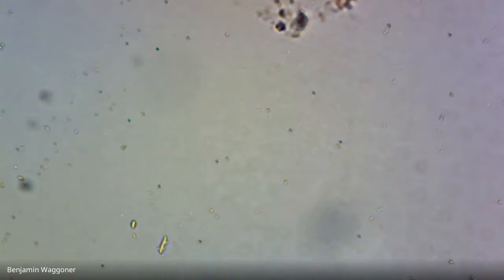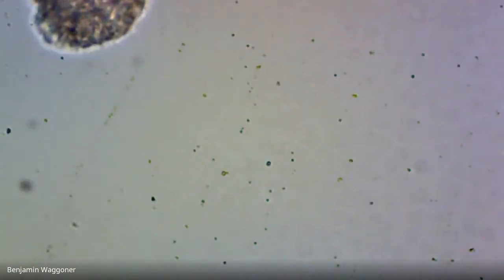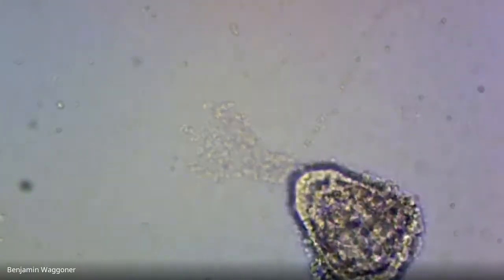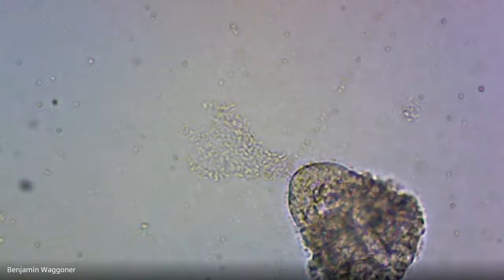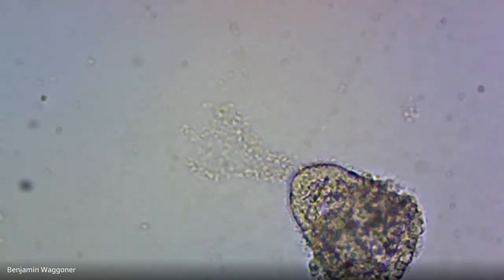Let me see here. Okay, that's a prism larva, but that one's pretty messed up.